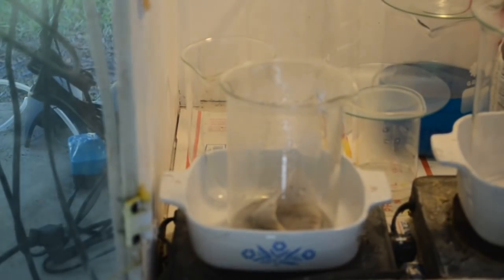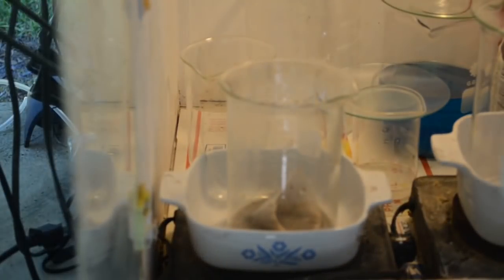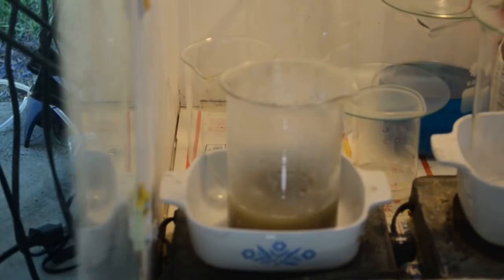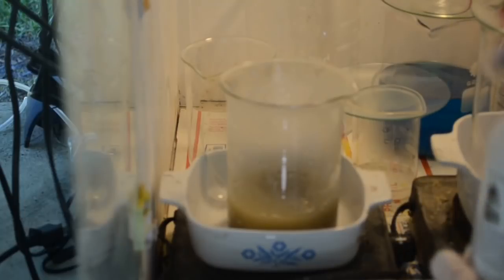Let's make some aqua regia. We get the fume hood going. Put in some muriatic acid. And some nitric acid. And we will dissolve that gold in there.